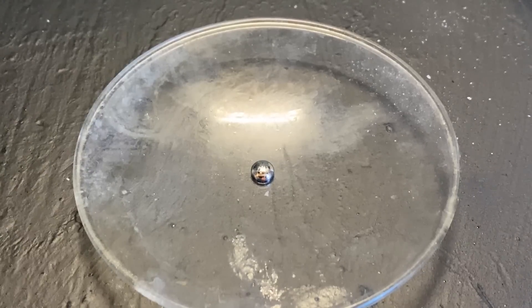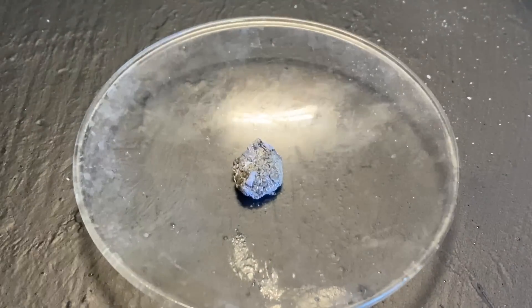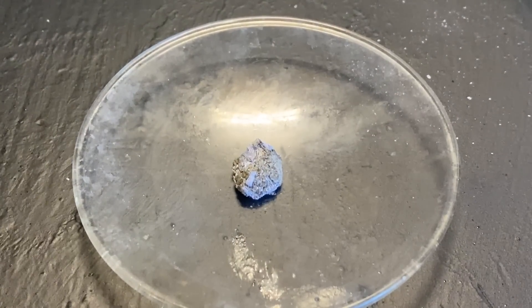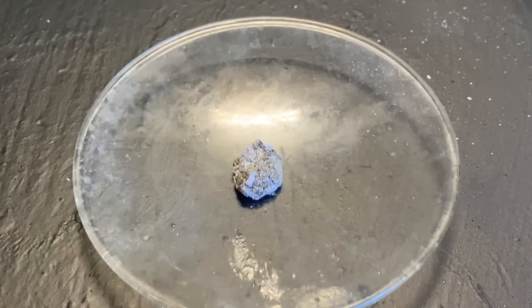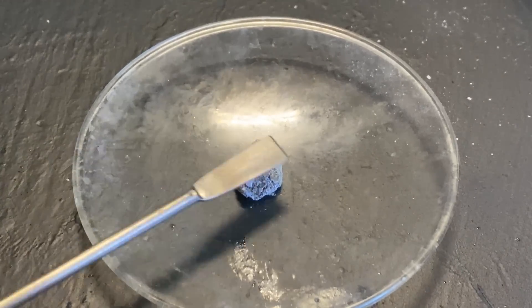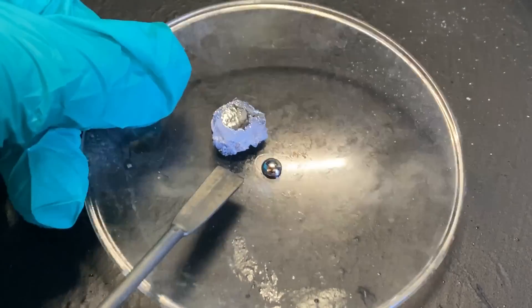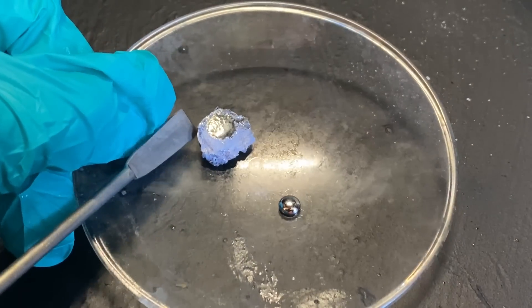Alright, no more messing around. Here's a little bit of mercury, and I've added some fresh potassium into it. I've made sure to place the potassium on the shiny end, because otherwise the mercury wouldn't be able to go through the potassium's oxide layer. After all that, I flipped the potassium, and you can see the mercury has already infected the potassium blob.